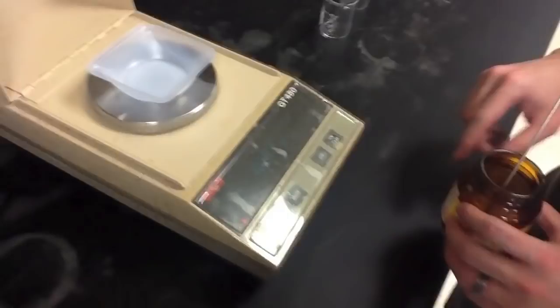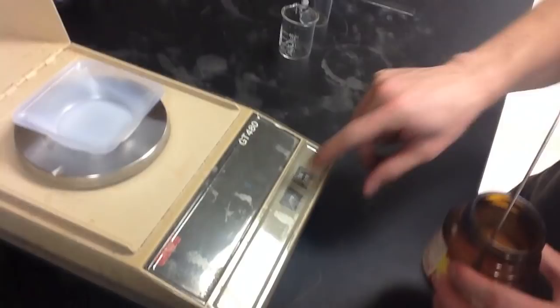We begin the fermentation exercise by measuring out the appropriate amount of yeast that will be added to each fermentation tube. We do this by utilizing the digital balance.